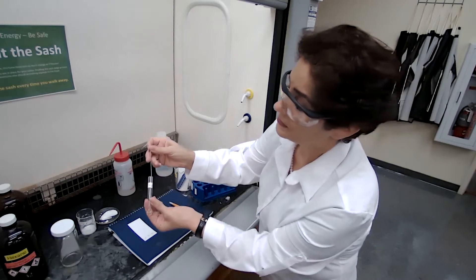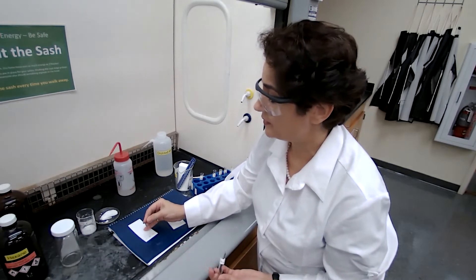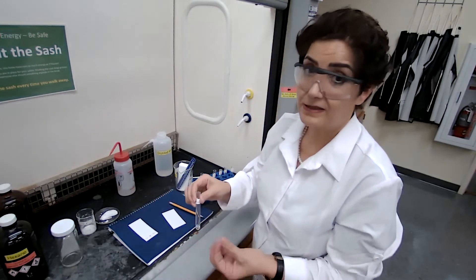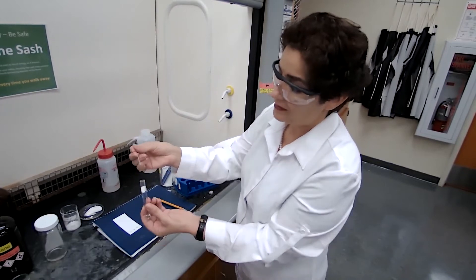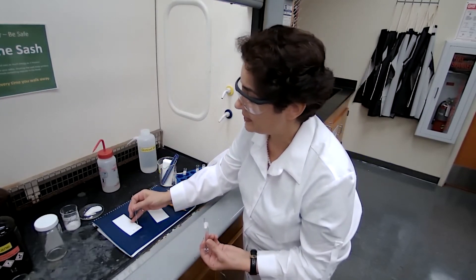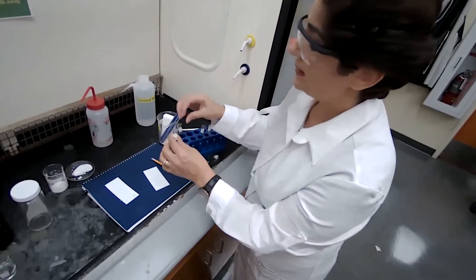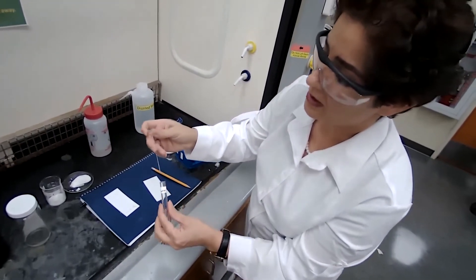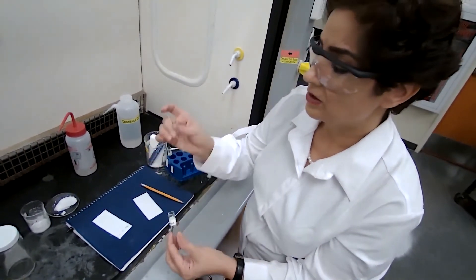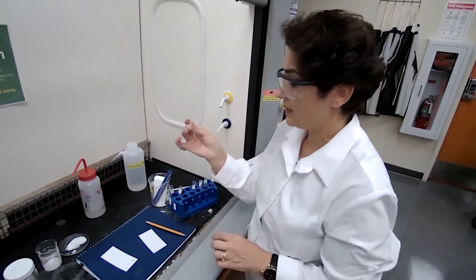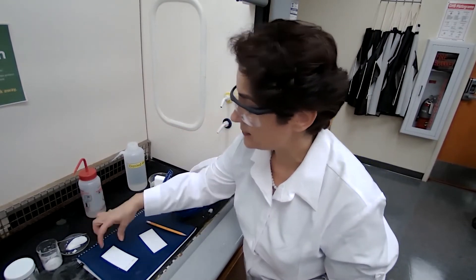I only make small amount of the solution because it doesn't take too much of a sample. That's one of the benefits of the chromatography. Chromatography is considered a non-invasive technique because if you only have one drop of sample, you can do chromatography. And for the mixture, just see how I'm applying the mixture, I just put one drop of the acid. And on top of that, I'm going to add one drop of the neutral compound. So I can't put this back in the test tube because it did touch the acid.